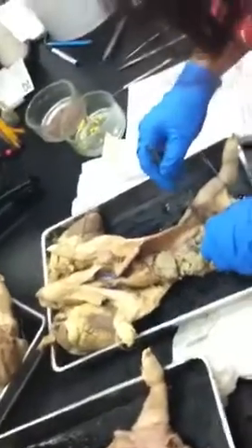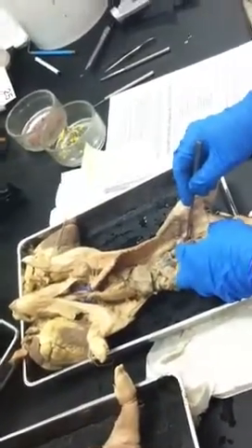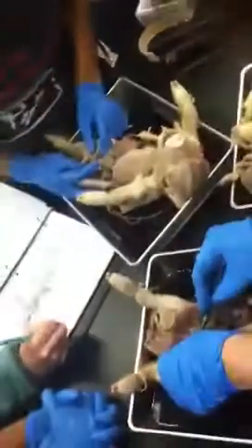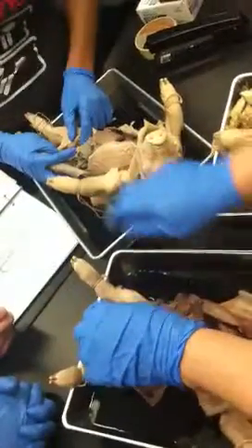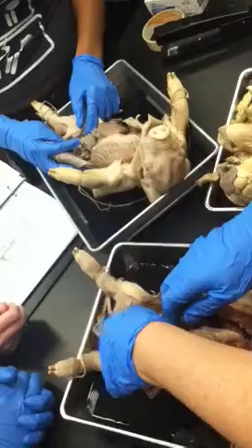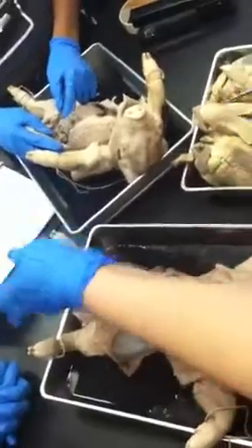The veins, there's a common iliac, and it's going to be underneath the external. So there's a common iliac vein, and it should be under the external. And then that splits, and the one that heads toward the middle, the medial portion, is the internal iliac, and the external iliac vein keeps going down.